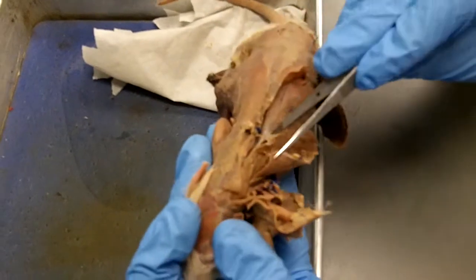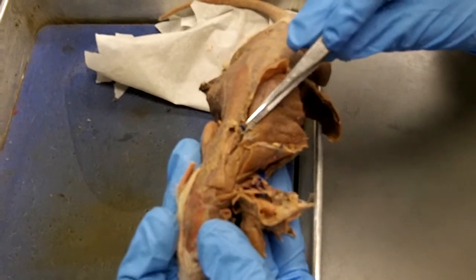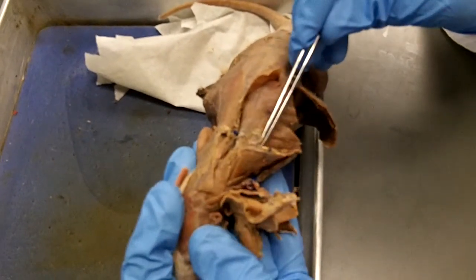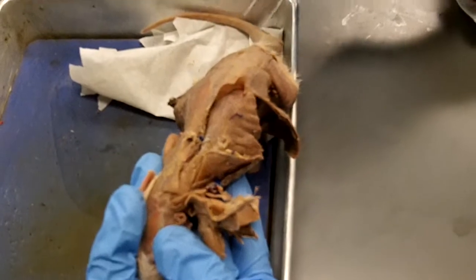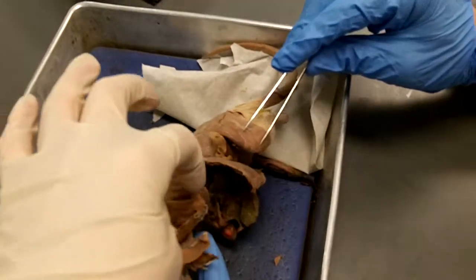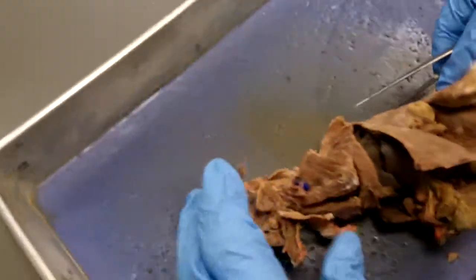The serratus dorsalis attaches by this sheet of clear connective tissue. It's called an aponeurosis. If we cut that aponeurosis, we can pull serratus dorsalis back out of the way, and then we see the erector spinae muscle, but it continues all the way down the back. And then is this part down here abdominis rectus or rectus abdominis?